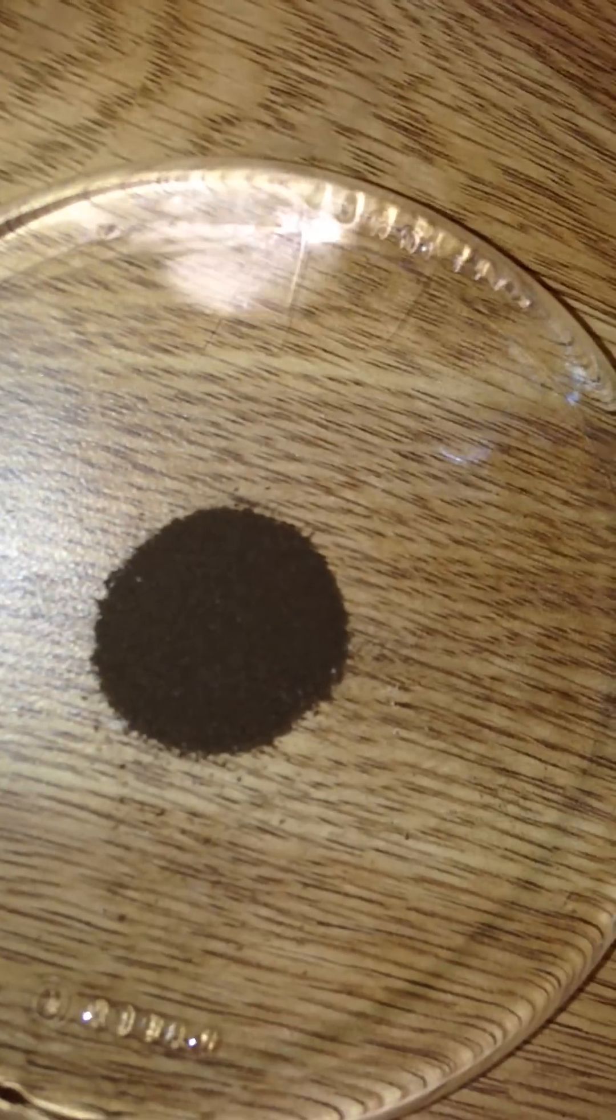And once you think that you have most of the sand out of the iron filings, you're gonna go ahead and just drop the iron filings onto your watch glass. And yeah, we did pretty good. Yep, you're a genius. Thanks.